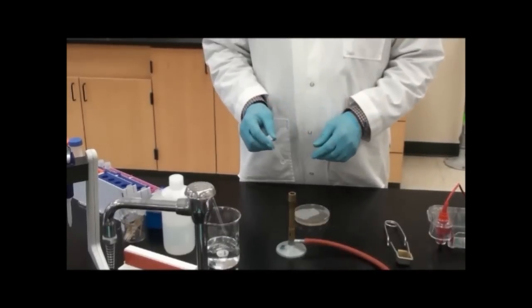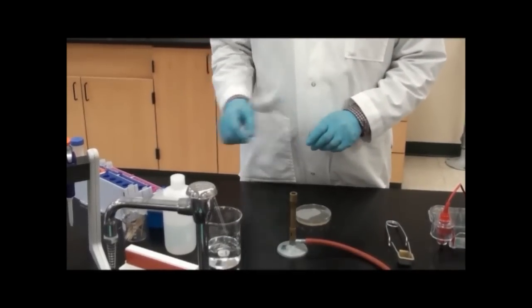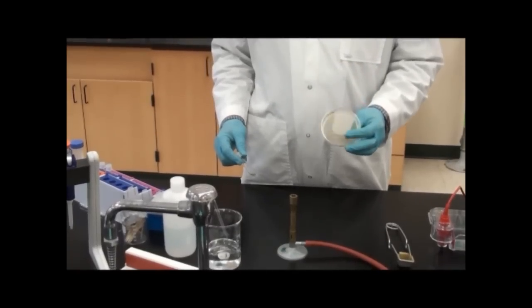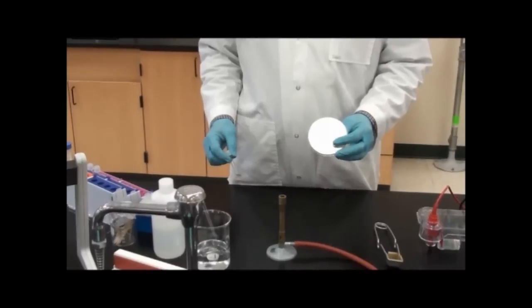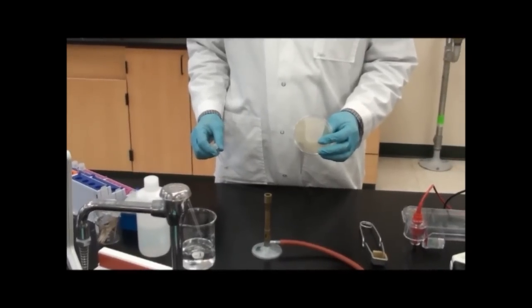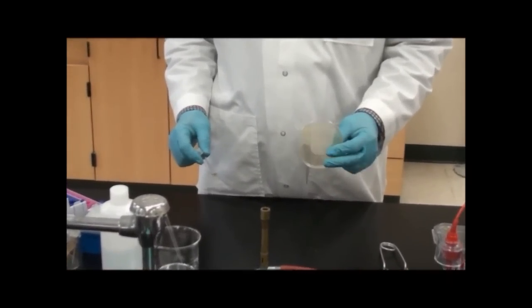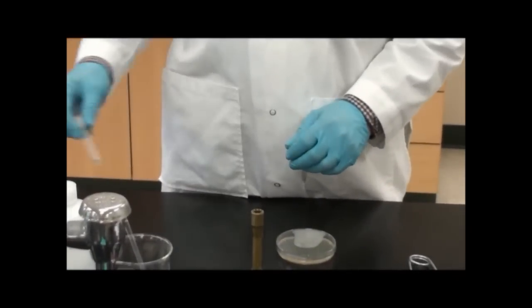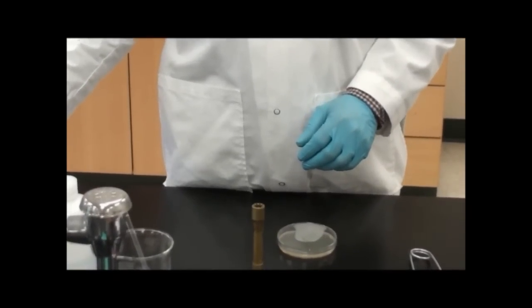I now have my culture competent cells and I'm going to put them on this selective media. This is LB agar with the antibiotic ampicillin. That's going to be a selective antibiotic for colonies that have taken up our plasmid DNA.